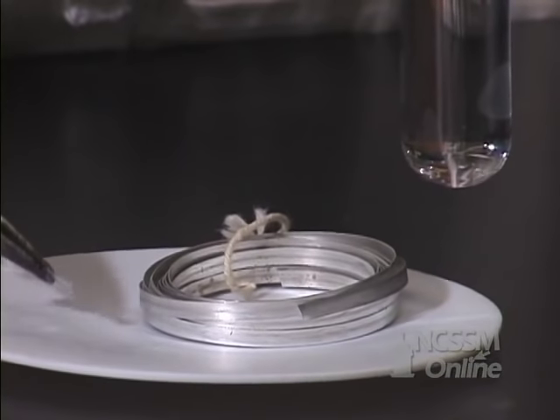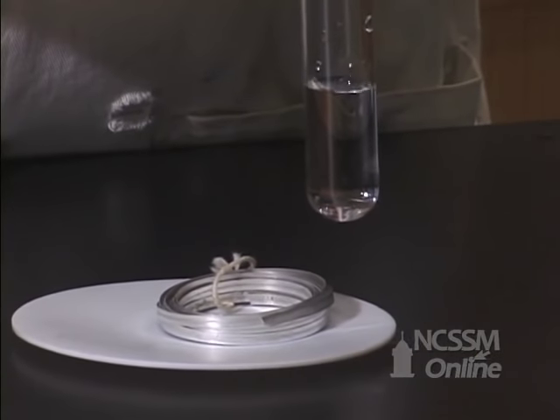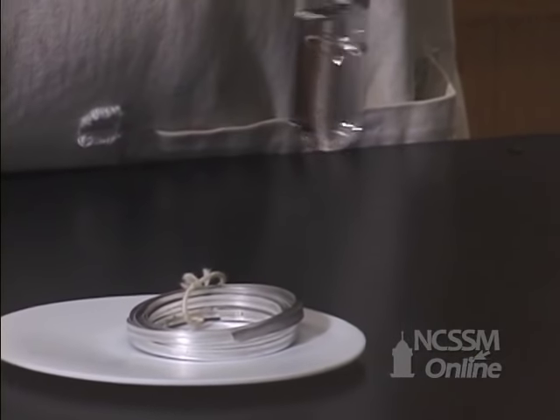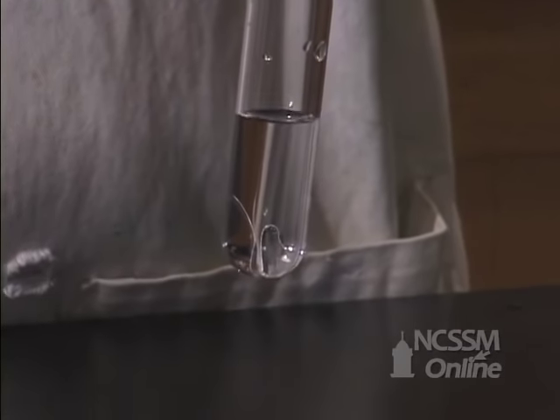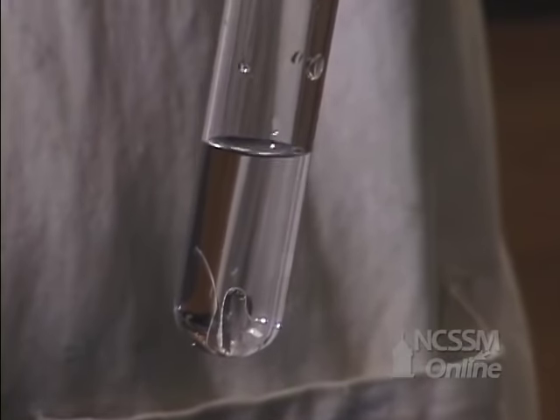If we add the magnesium metal to some water, we notice that the magnesium metal sinks. Group II metals are more dense than water. We also notice that there's no apparent reaction between the magnesium metal and the water.